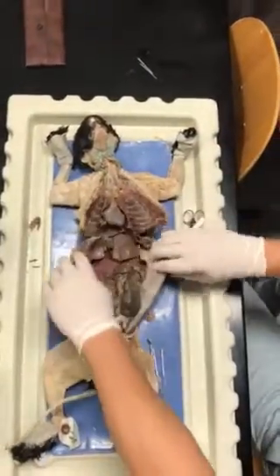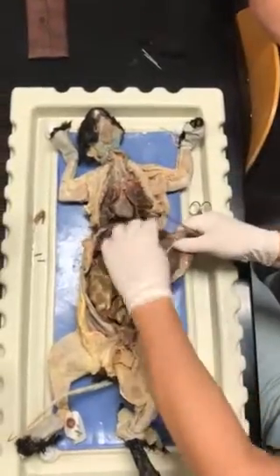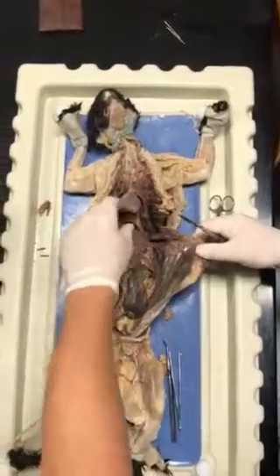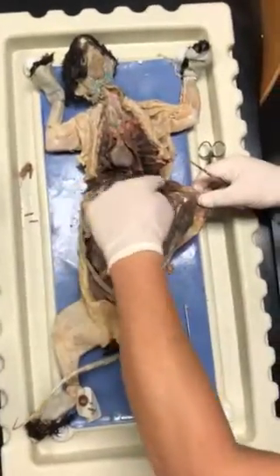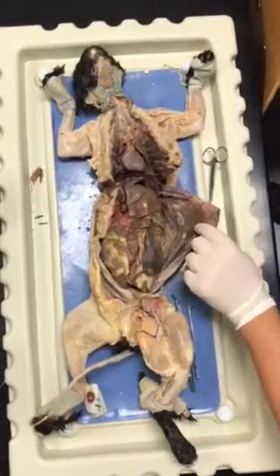Okay. Let me get the last one. Guys, here's that diaphragm that we want to be cutting away. Here's the diaphragm right here, because we can see here's the thoracic cavity, here's the diaphragm, the dome of the diaphragm. So we want to cut this away. Somebody can hold that there.